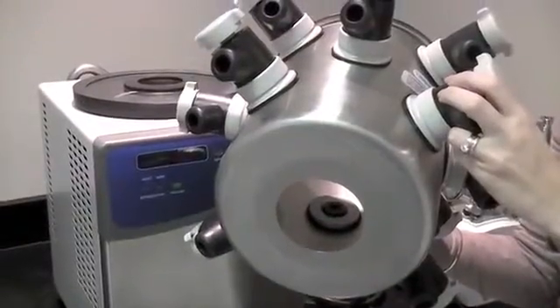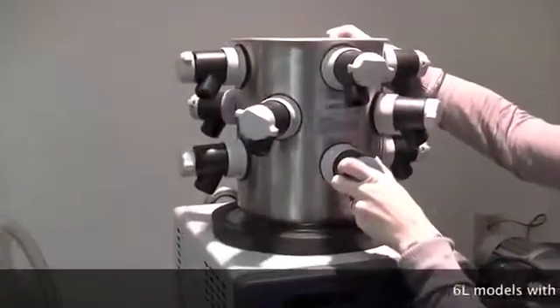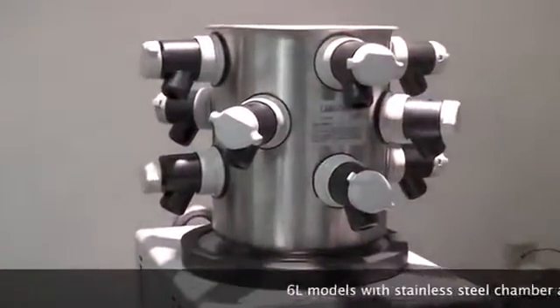Place the drying chamber or manifold over the gasket so that the holes on the drying chamber, gasket, and collector chamber lid line up.